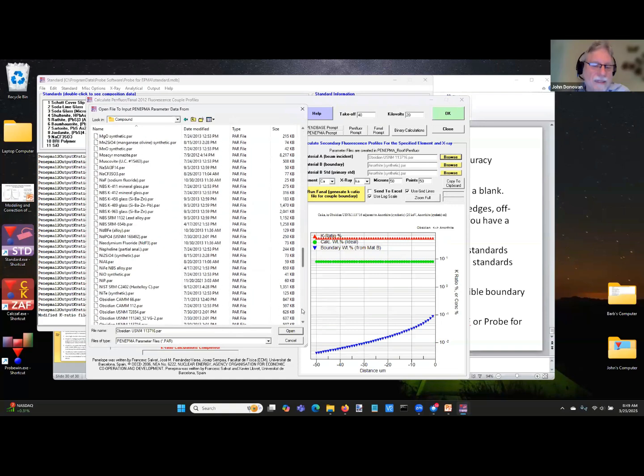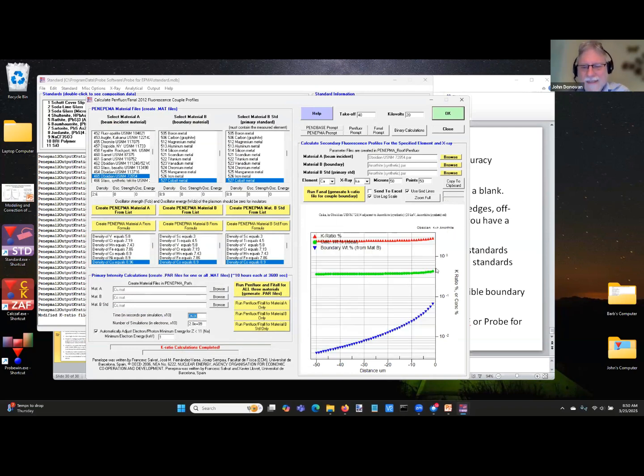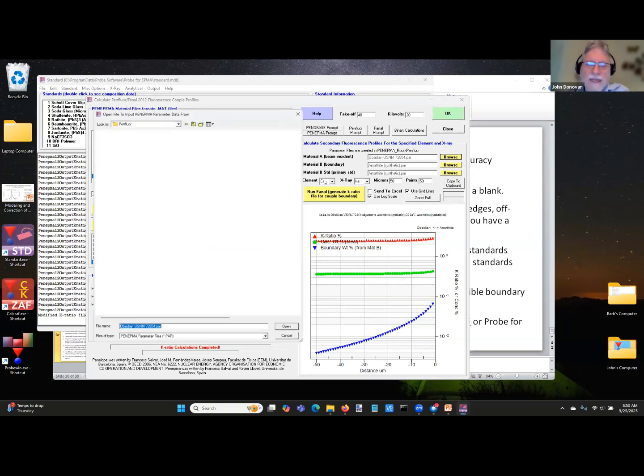It's possible. So that particular obsidian has a lot of calcium in it, so it's not a problem. As you can see, I had to go to log scale to actually see the effect. I think this obsidian has less calcium in it. Is that correct? Can't remember now. I don't have these all memorized. Yeah, there is an effect, but there's a lot of calcium in this material, so it's a smaller effect.